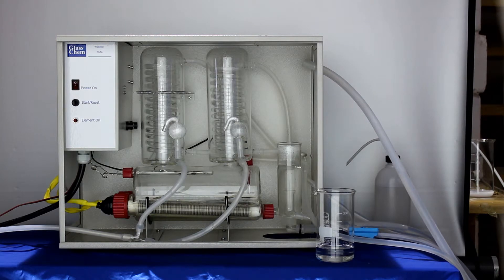Be very careful when working with acid and wear gloves if you are in doubt of your own safety. Leave the acid long enough until you see there is no further effect of the acid inside the boiler.